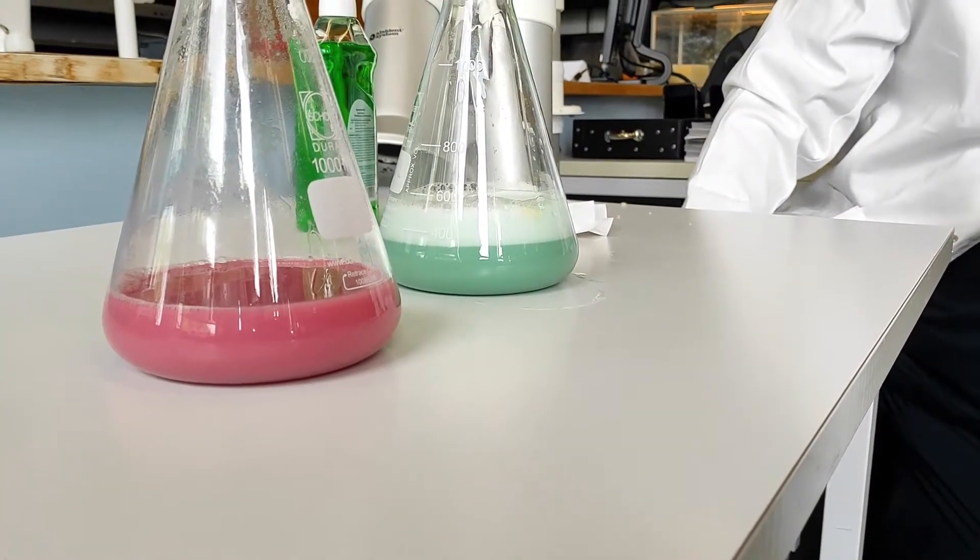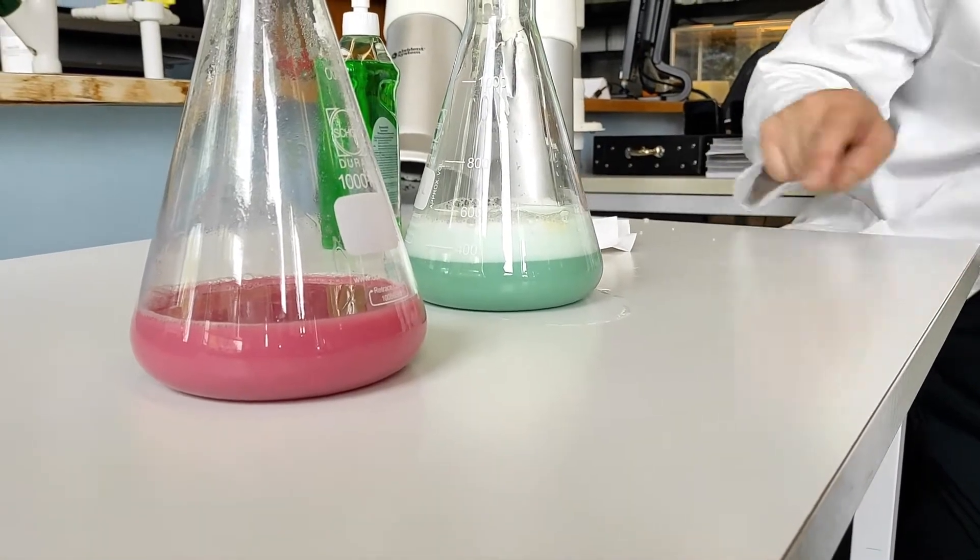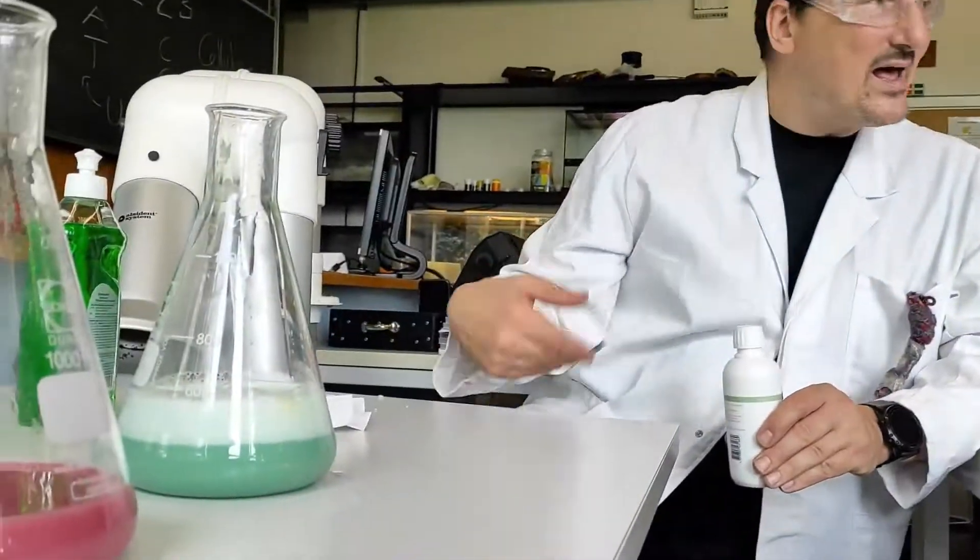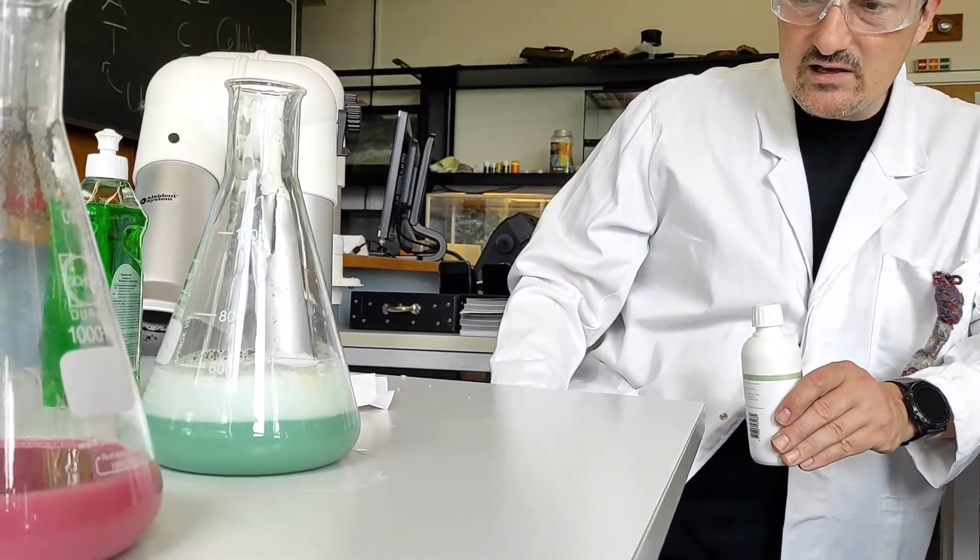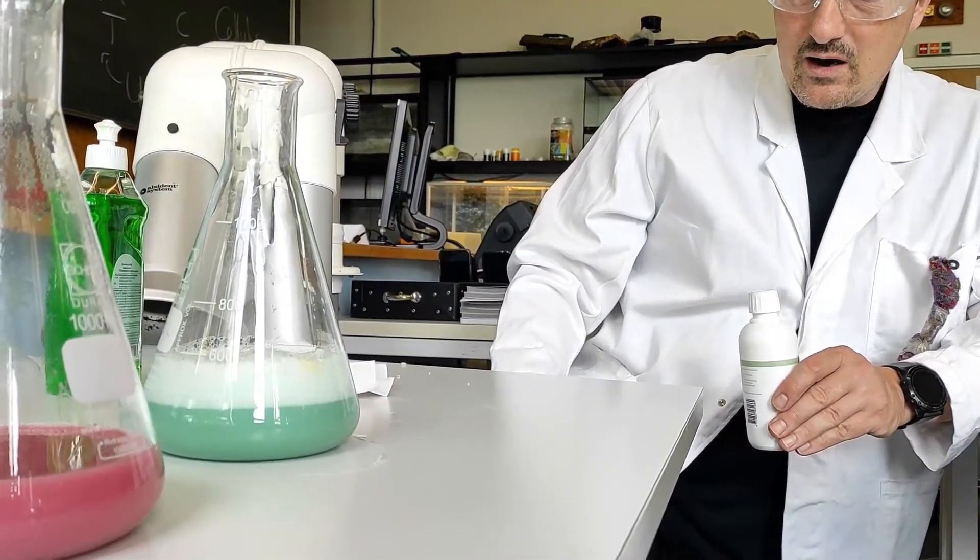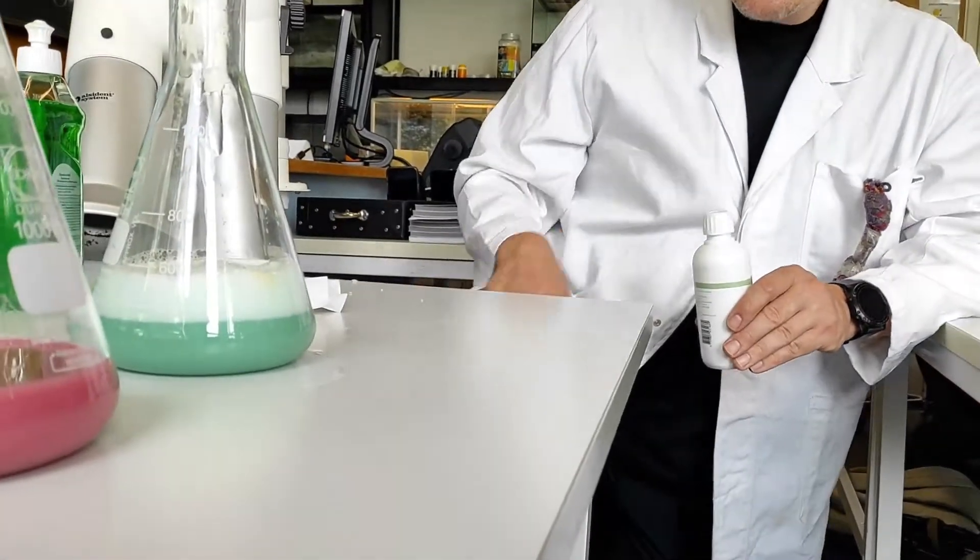This used to be a little faster because I only got the weak one. But we can see here that foam is starting to form as the enzymes inside the yeast are breaking down the hydrogen peroxide.